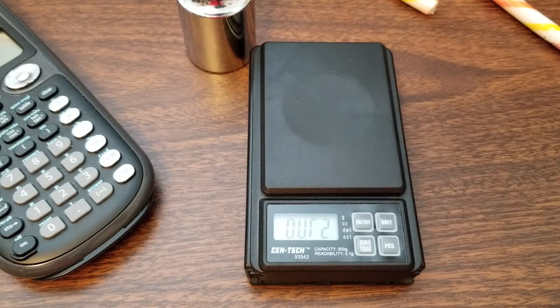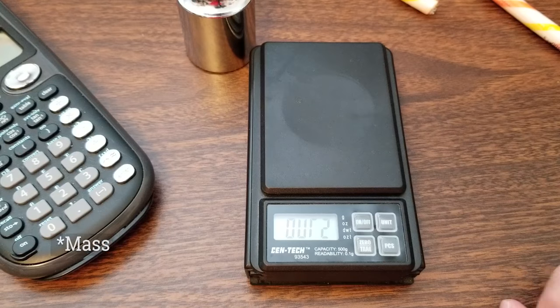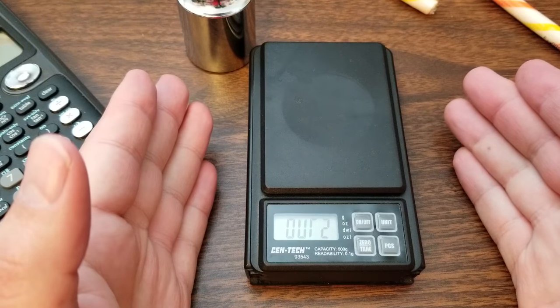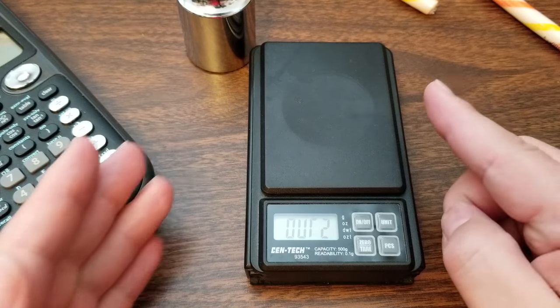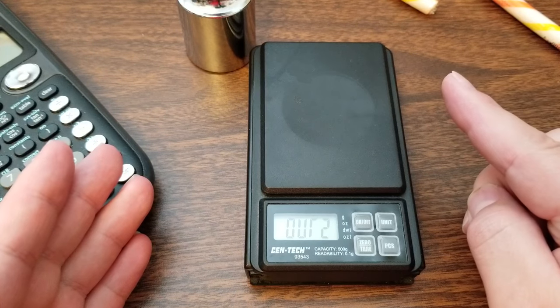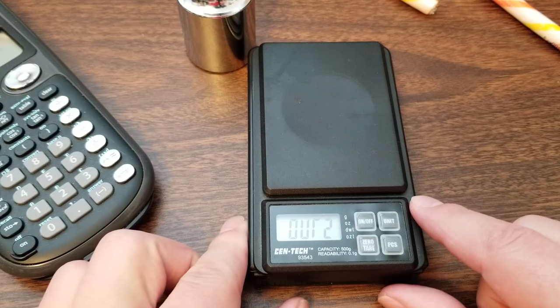In the lab, we need some tools to be able to measure things. Sometimes we need to measure weight. Now, this isn't the greatest tool for doing lab-style stuff, but for the at-home amateur, it may be good enough. But let's recalibrate.